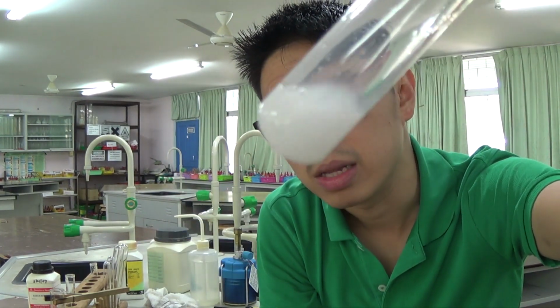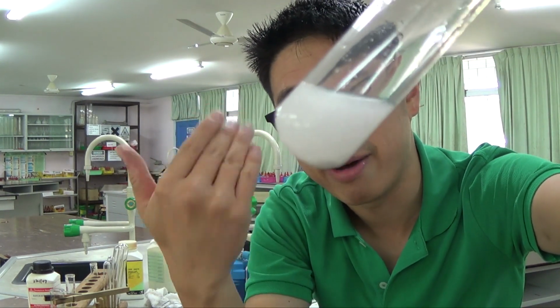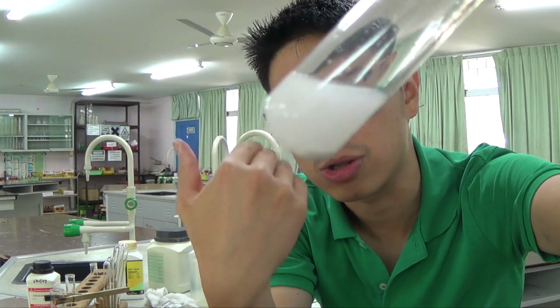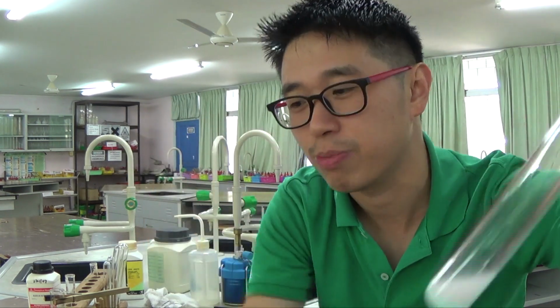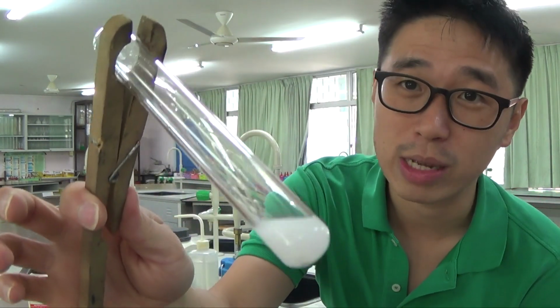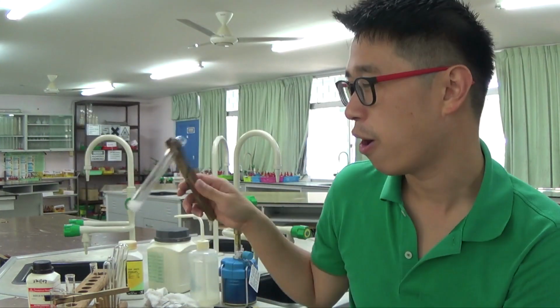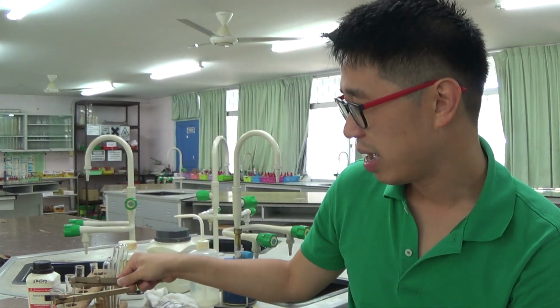As you could see, this is a precipitate because you cannot see through. You see on the screen, you cannot see my face through the test tube because that is a precipitate. This is not a white solution. Do not ever write white solution. It's a very common mistake among students. I wouldn't say it's a mistake, it's probably that learners are misguided and confused between what is a solution, which is see-through and transparent, versus what is a solid and a precipitate.